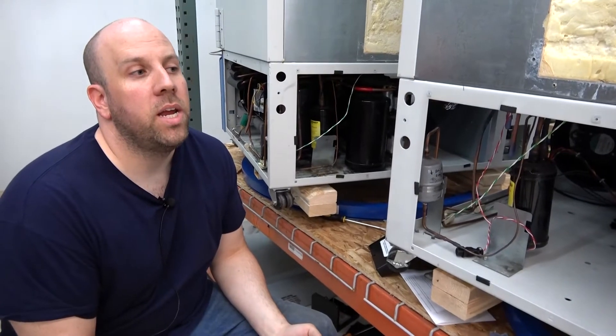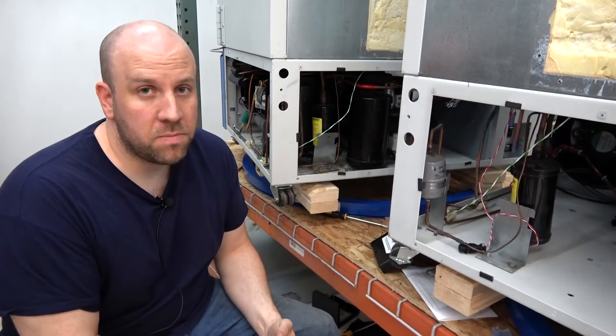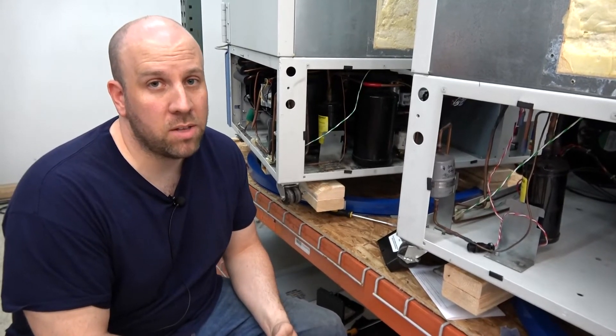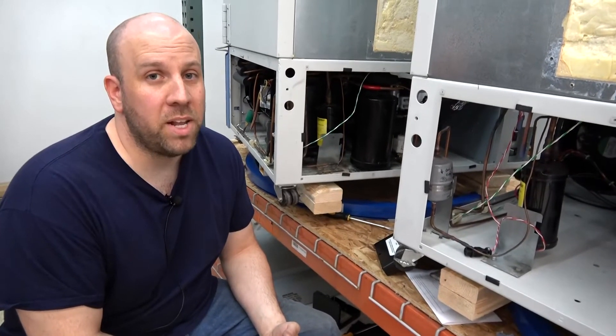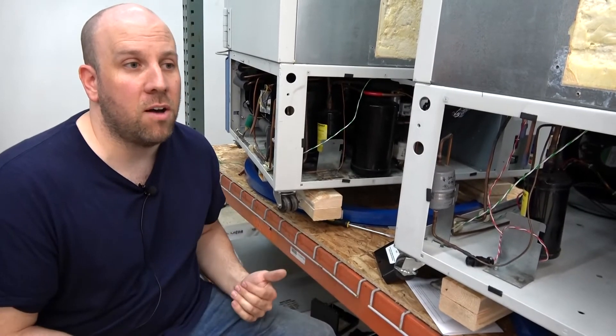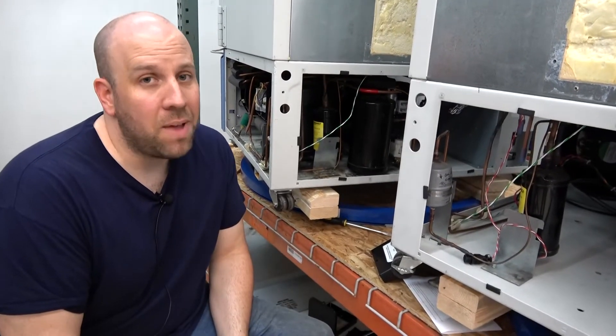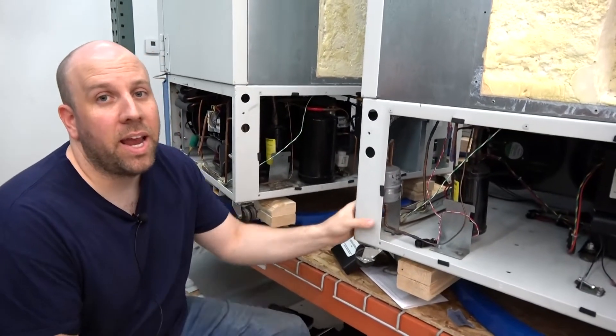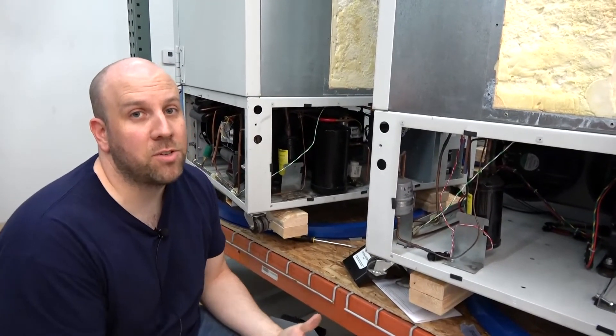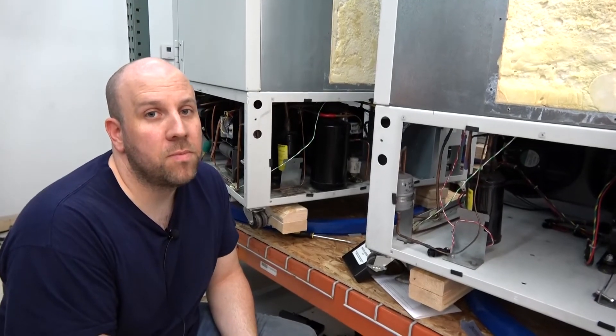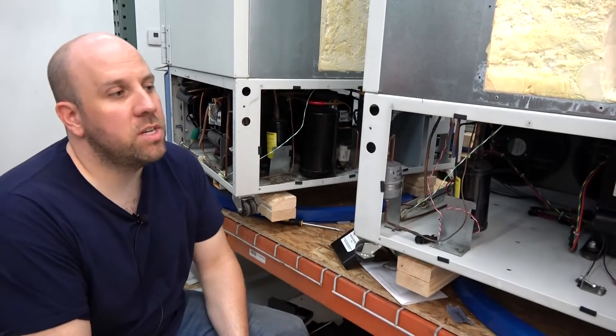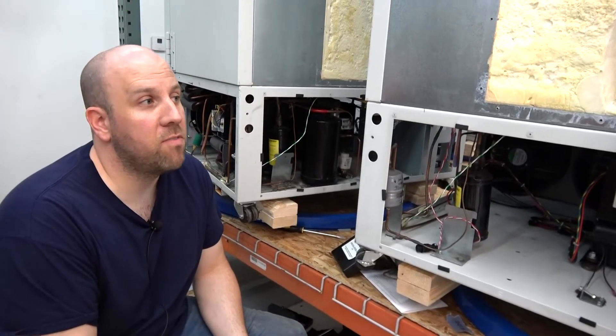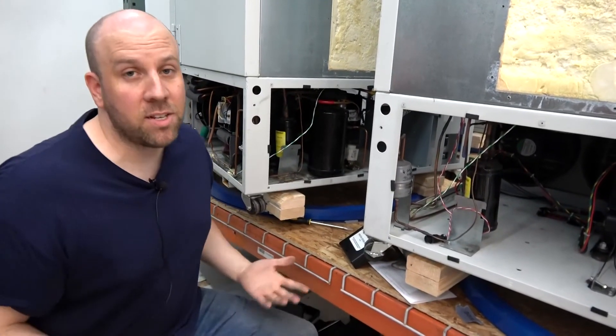We evacuate it with our vacuum pumps to manufacturer spec, under 200 microns for at least 20 minutes. It has to hold that once the vacuum is off. So sometimes it may take hours or days for the second stage to be evacuated and reach the manufacturer spec for moisture. So we do that and then we recharge it and run the unit and verify that it performs like it should, basically performs brand new.